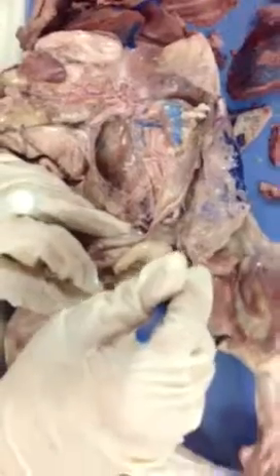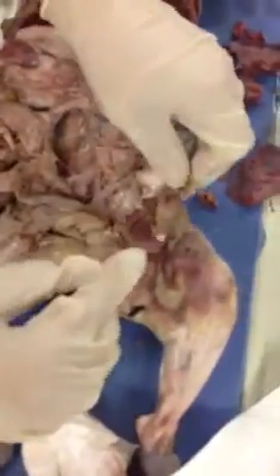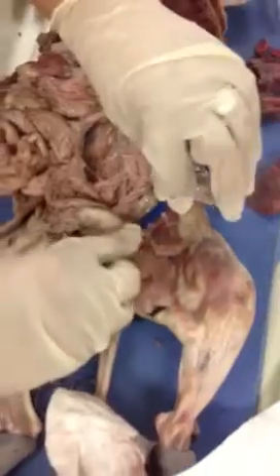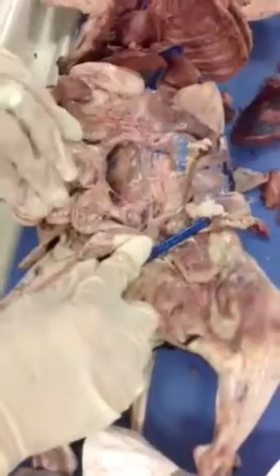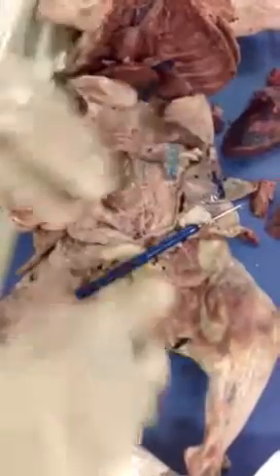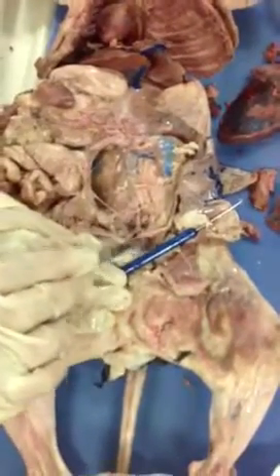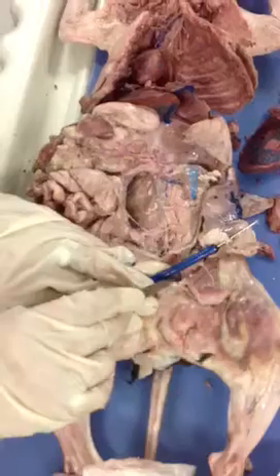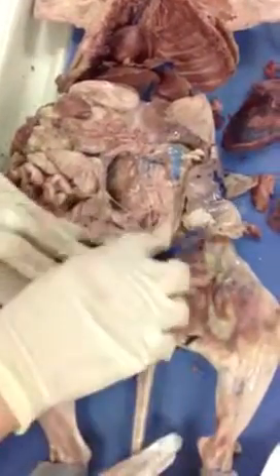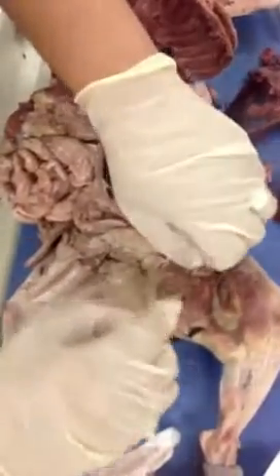Now, you're going to continue to dissect into the leg. Because remember, you see how I'm just following, right? Once you trace an imaginary line here, this is tracing the groin, okay? So once again, like that analogy that we said, like street names, the iliacs, when they're above the inguinal canal, are called iliacs. Past this, they call them femoral, right? So you're going to continue your dissection, continuing separating with the probe, until you find the rest of the arteries. Proceed.